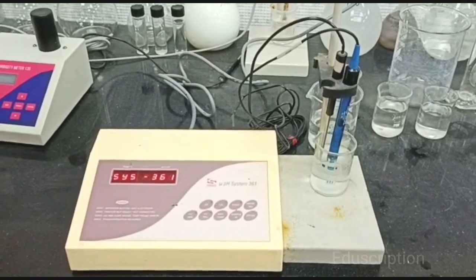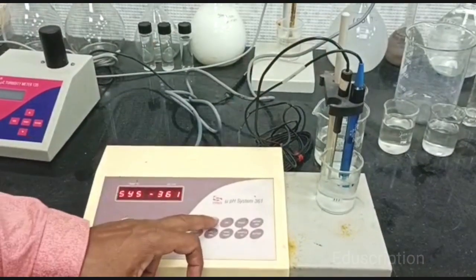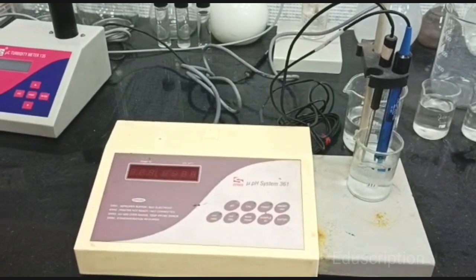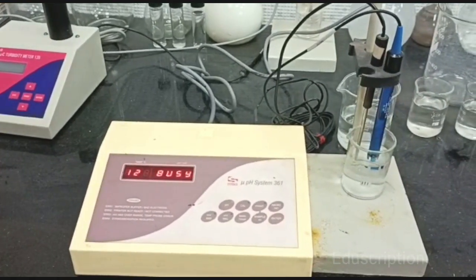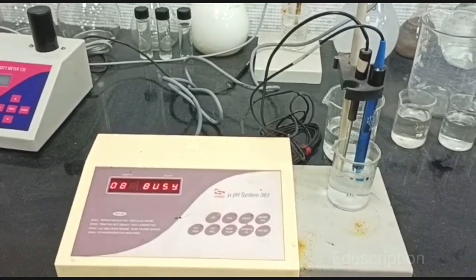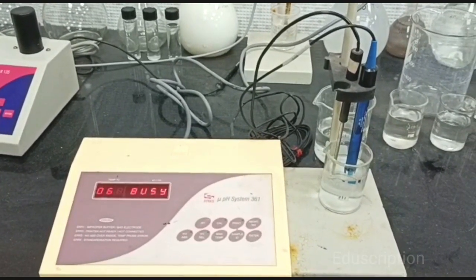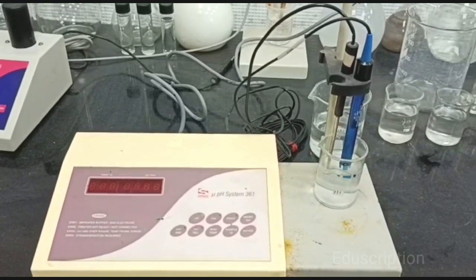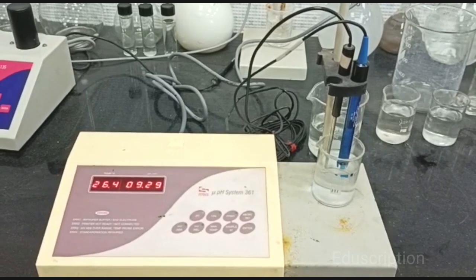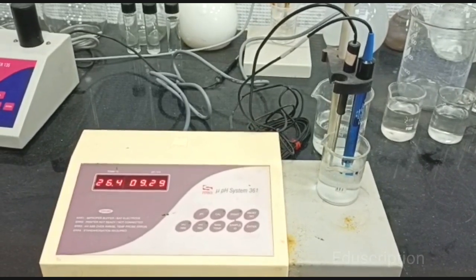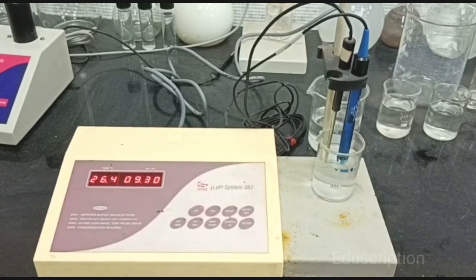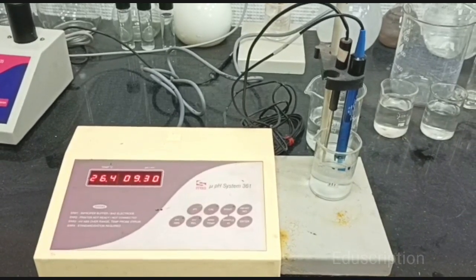Now we will go for third reading. Press pH key, then enter it. Yes, this is 9.29 or 9.30. This is basic or alkaline.